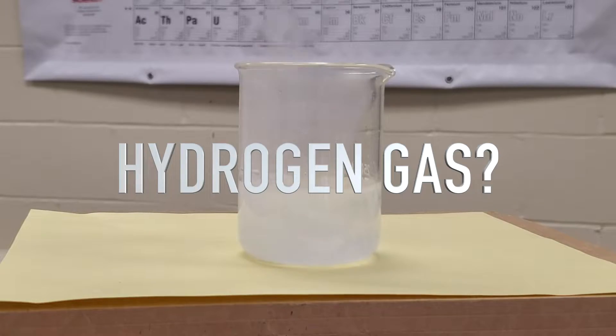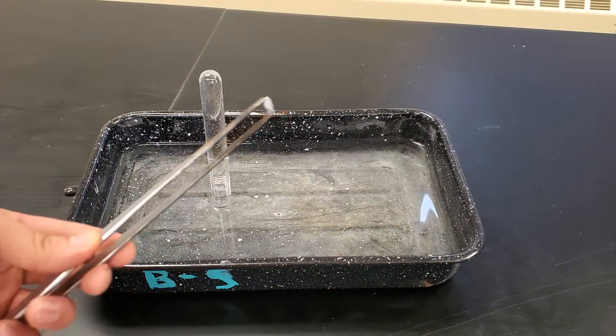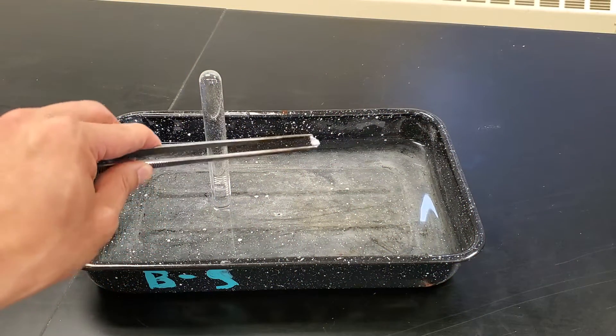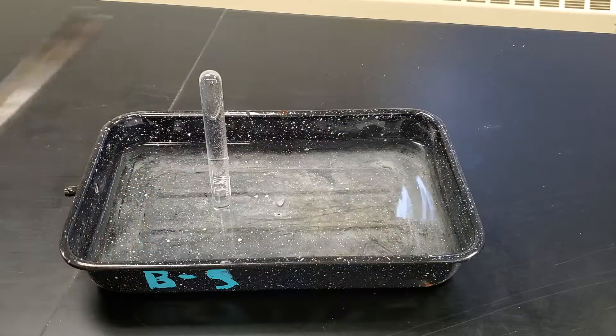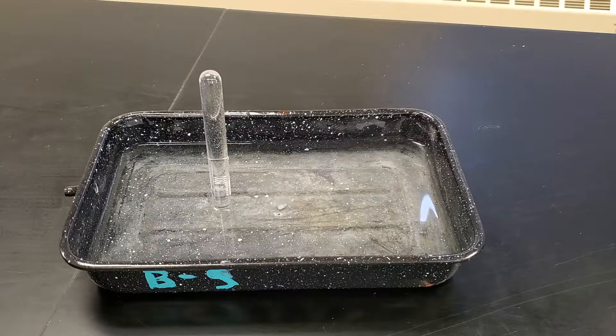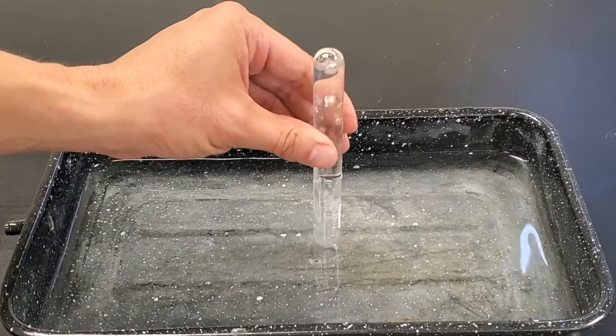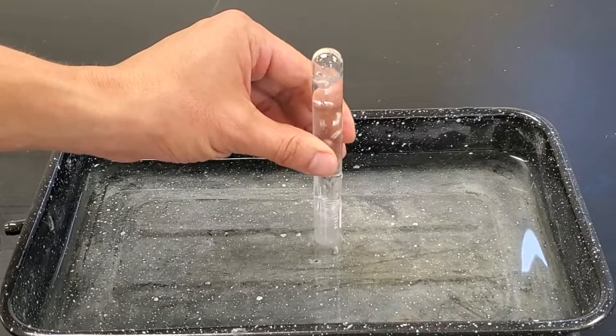How do I know that's hydrogen gas? I can collect it and test it. I'm going to drop some calcium into this pneumatic trough filled with water. Here I have a test tube that's been filled with water. As the calcium reaction gets going, I'm going to place this test tube over the calcium to collect the hydrogen gas.